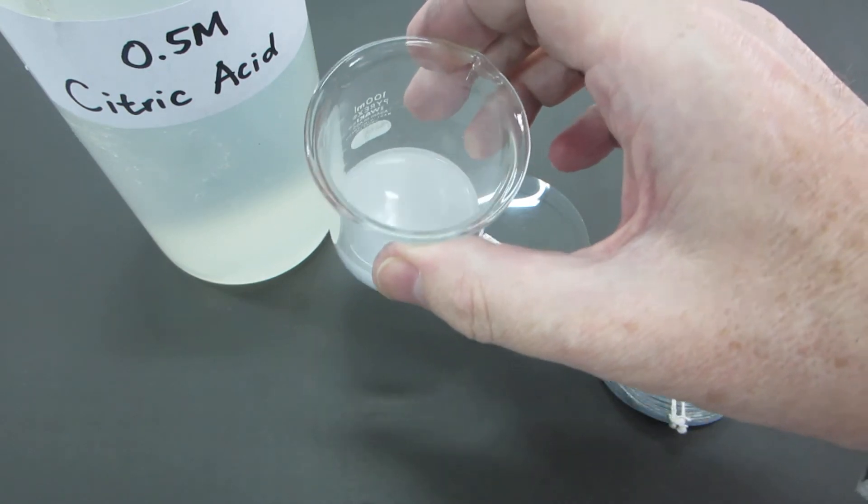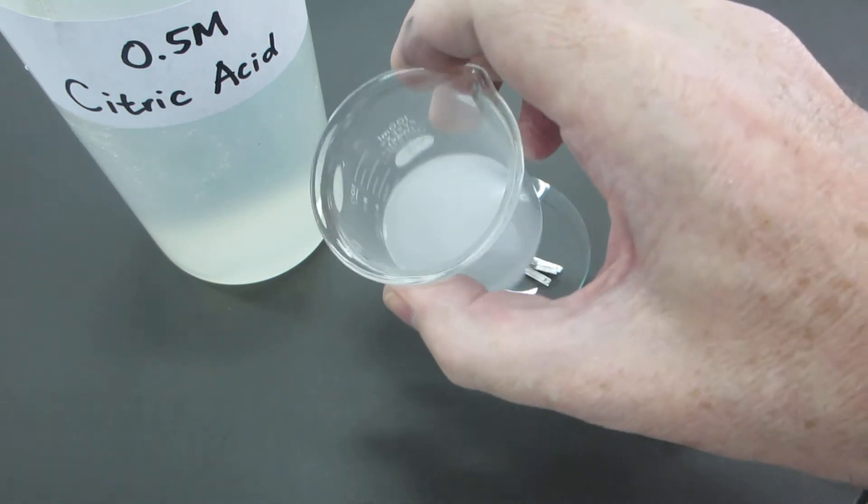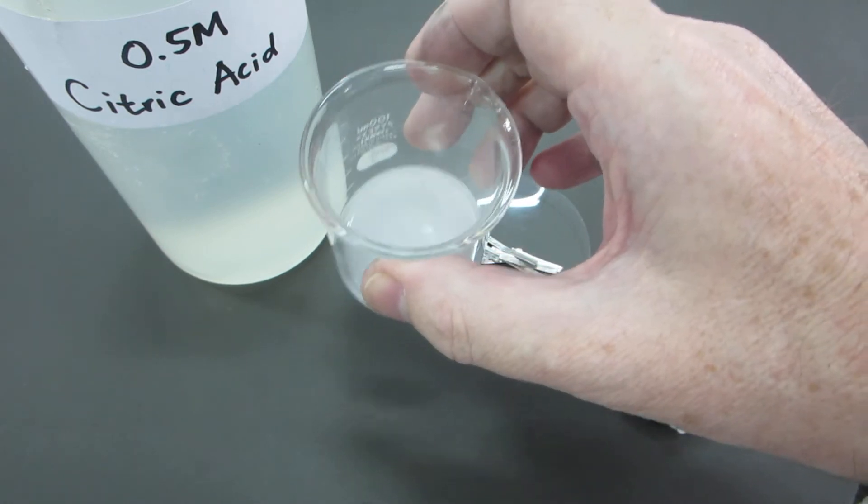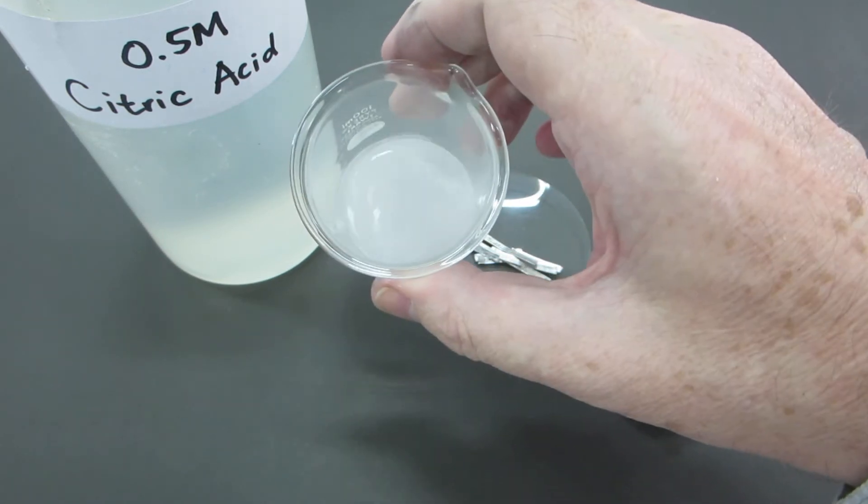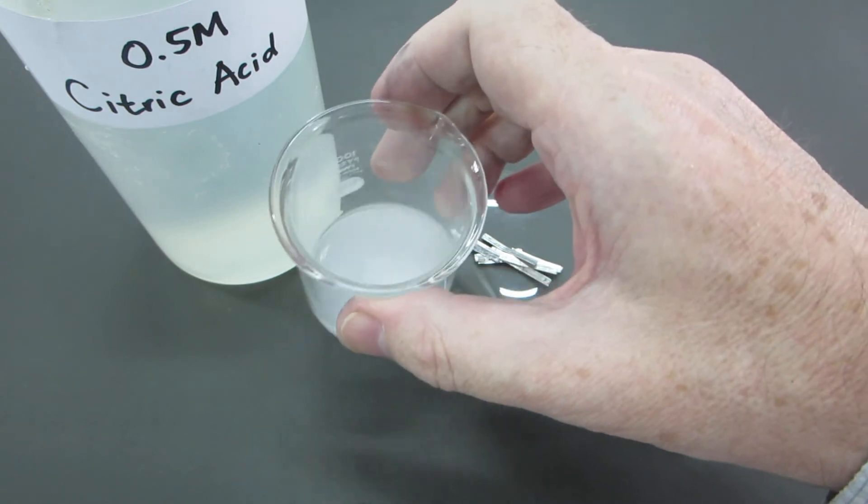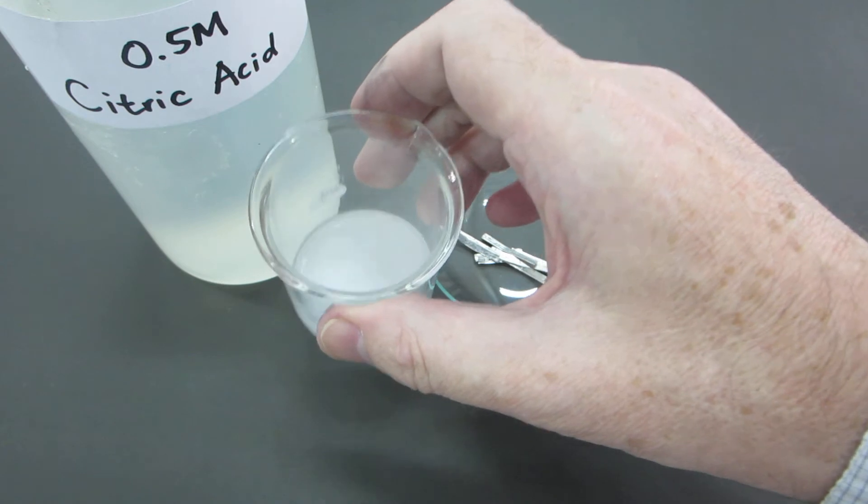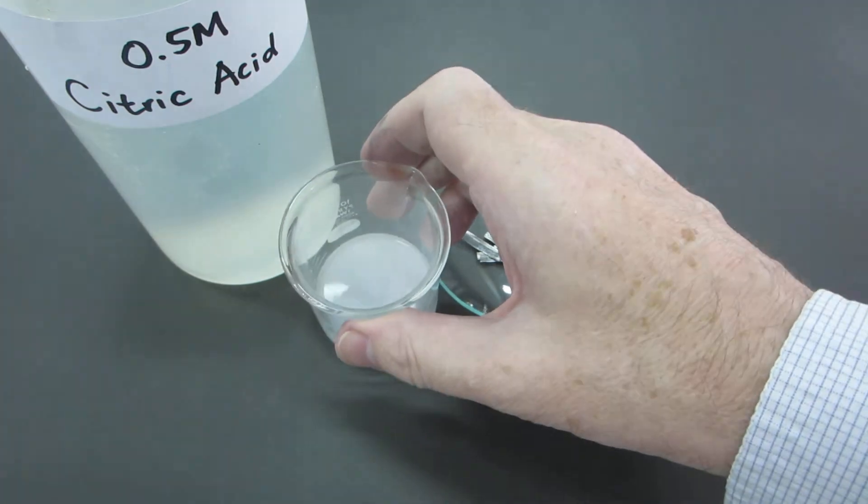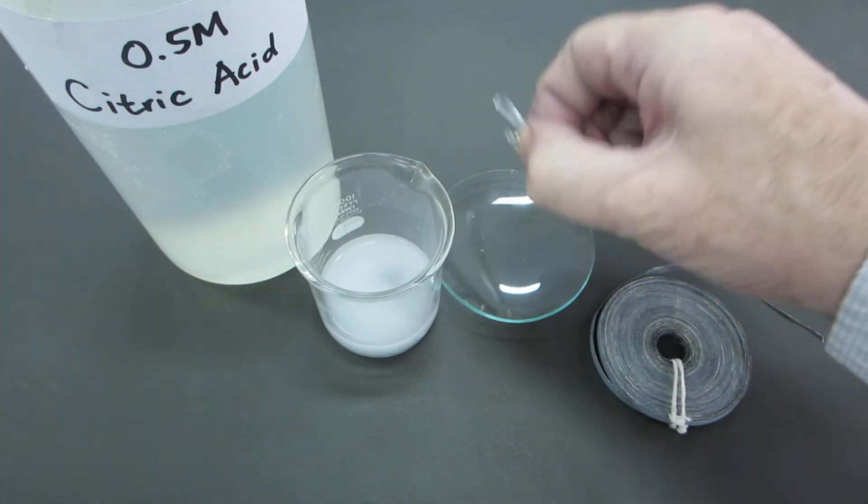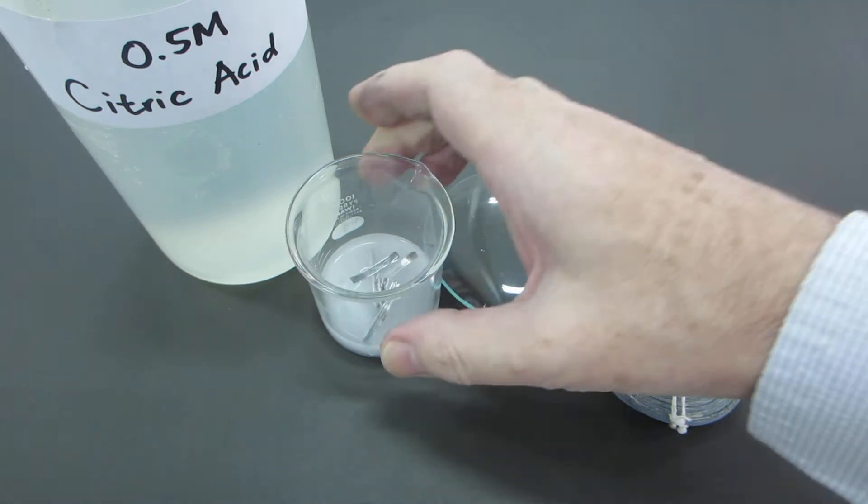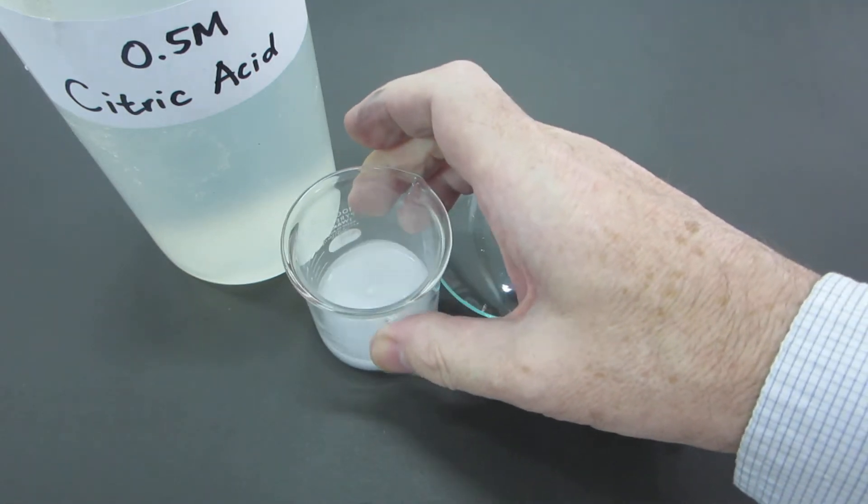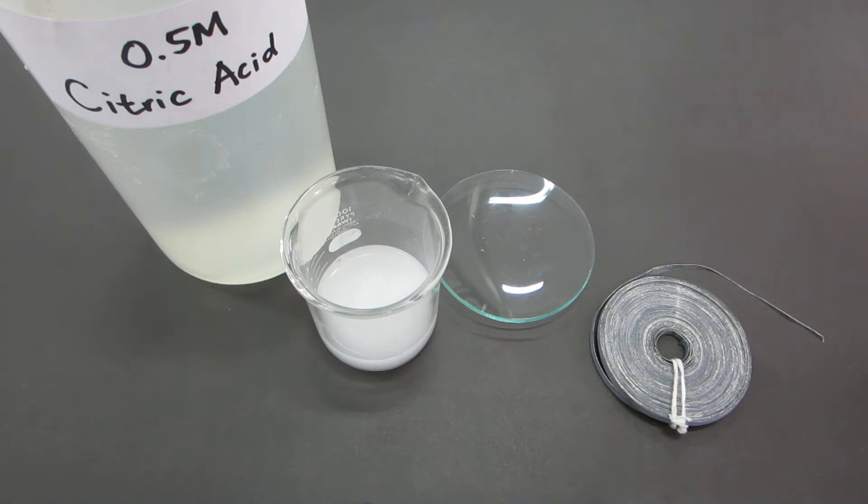Releasing a colorless gas as well as some other gases, and you may wish to carry this out in a fume cupboard. It will take some time to react, so let's add all of the magnesium and then we'll leave it for a few hours to react and come back later.